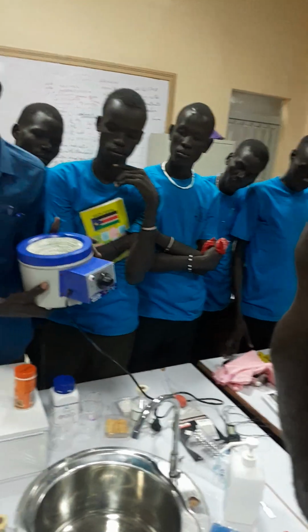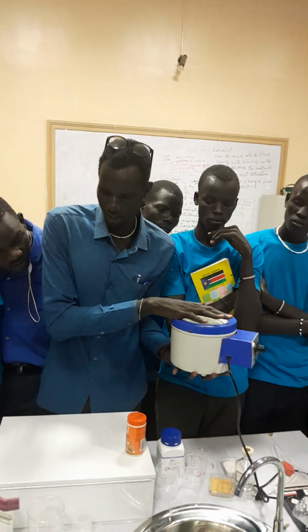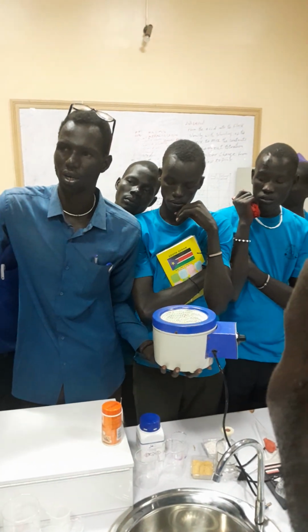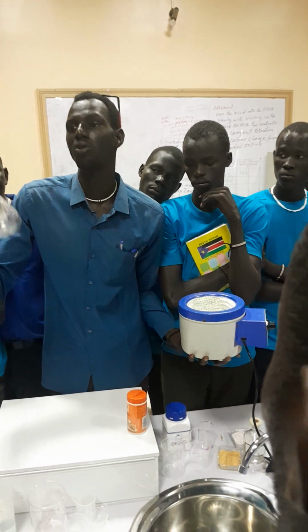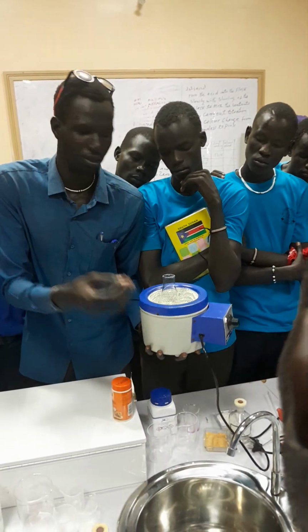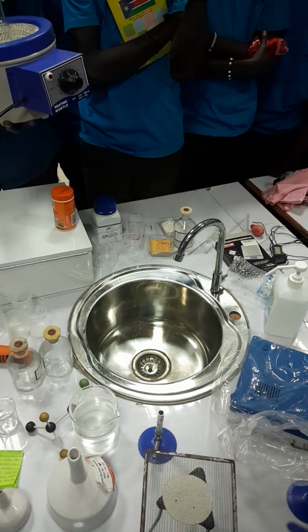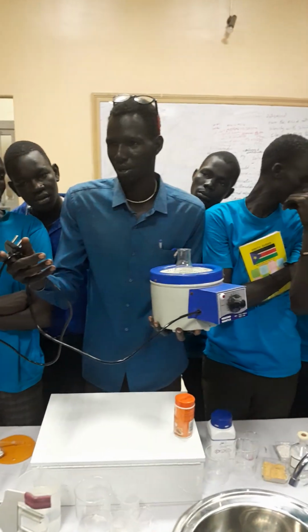This one is called the heating mantle. It is used for heating any substance. For example, if you put this conical flask here, with a substance, let's say a liquid, you pour it inside and you want to heat it using this glass, because if you subject it to fire, it will break. So you put it on this. It has heat absorption. Then you connect it to a source of current, like electricity, and from there you will see your water keep boiling. Then you use it for the purpose of your experiment.